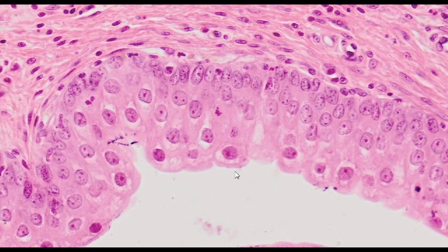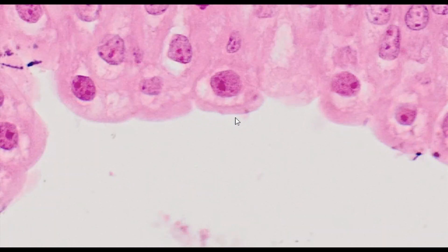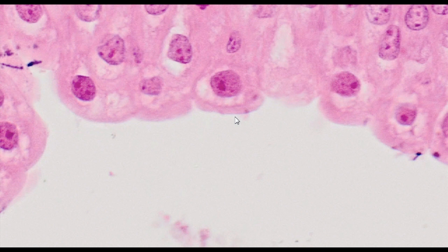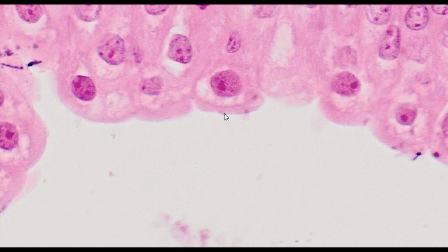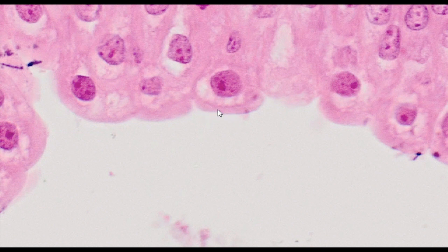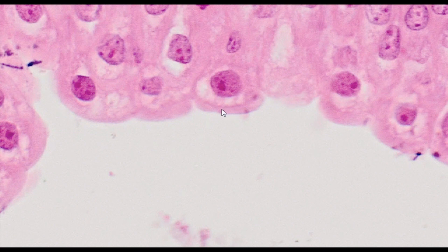In H&E staining, uroplakin plaques are poorly visible, and their presence can only be evidenced by a darker band of cytoplasm in the apical part of umbrella cells.